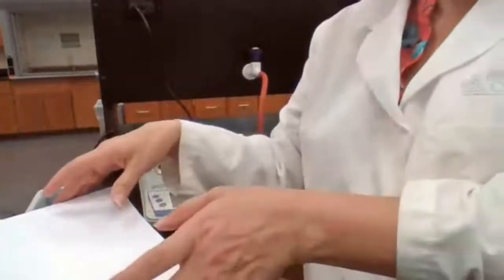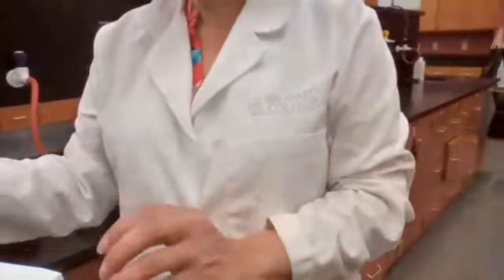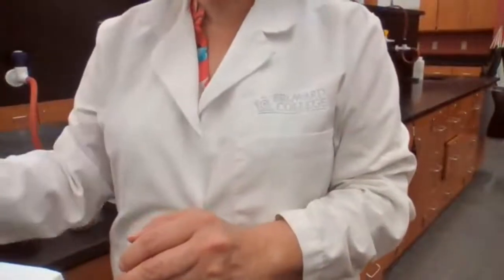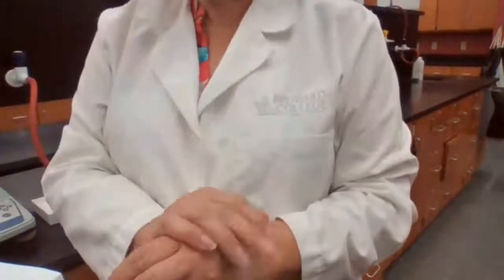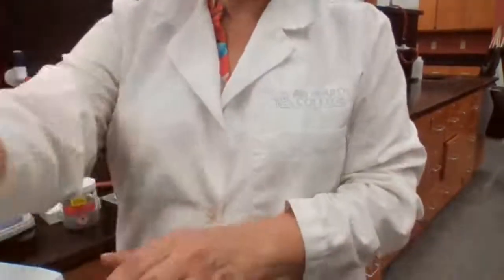Okay. So we have the mass of the iodine to start the reaction. We have the mass of the zinc that we started the reaction with. And we add the water, we add the acetic acid, and the reaction is going on. It might take 10 to 15 minutes. The dark color has to disappear and it should go to a colorless solution. If it's completely colorless, that is the ideal.